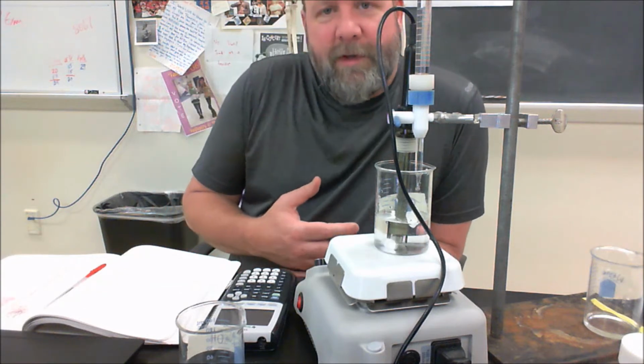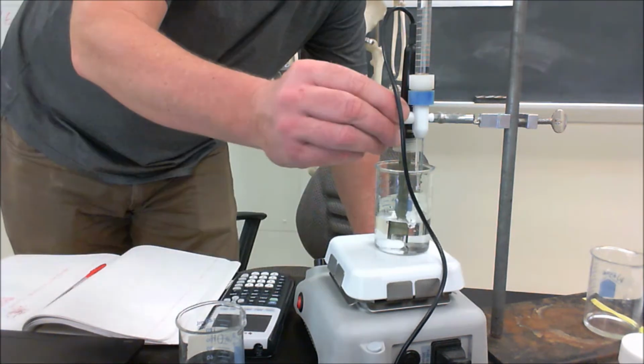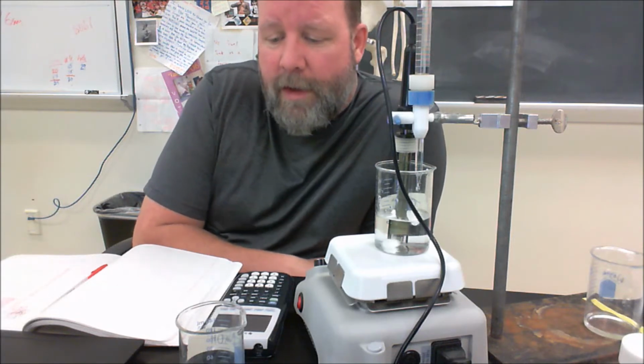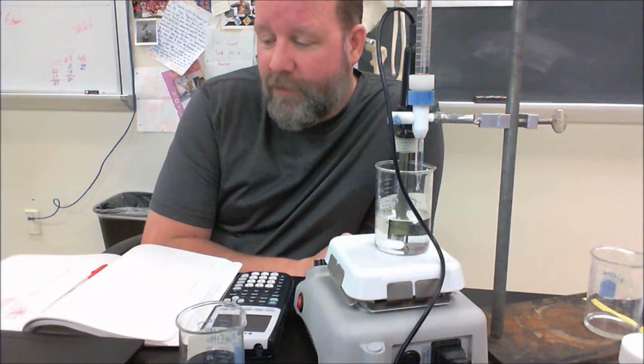The pH has jumped up to almost 11, so it's way up there now. And it's starting to flatten out again. So I've collected all the data from that one, and I'll take it home and I'll show you how to do the data analysis on it. So I'll do the first one, show you how we're going to calculate these things. So the second titration that we're about to do with the unknown acid, you will do all the calculations on that one.